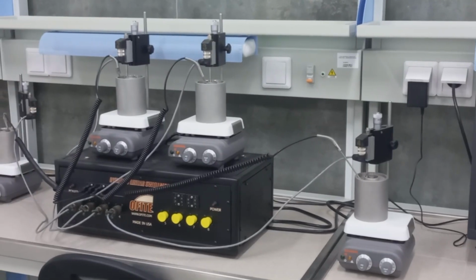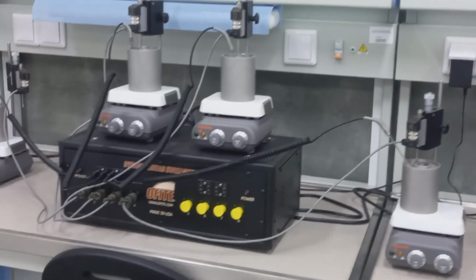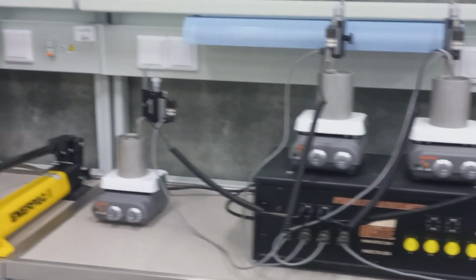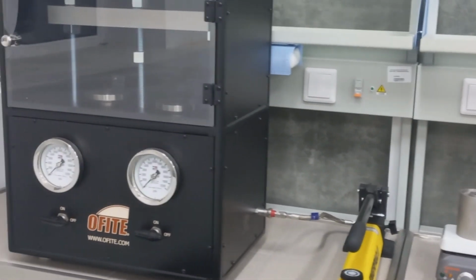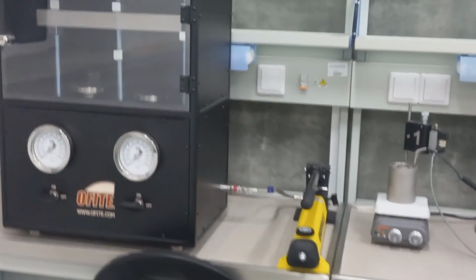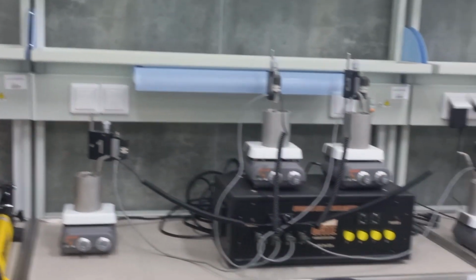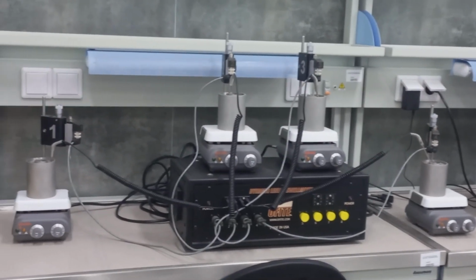The dynamic linear swell meter is designed to simultaneously test up to 4 drilling fluids on a representative shale sample for extended periods of time at temperatures up to 180 Fahrenheit. The linear swell meter is the only swell meter capable of dynamically testing fluids to obtain the most accurate data possible.